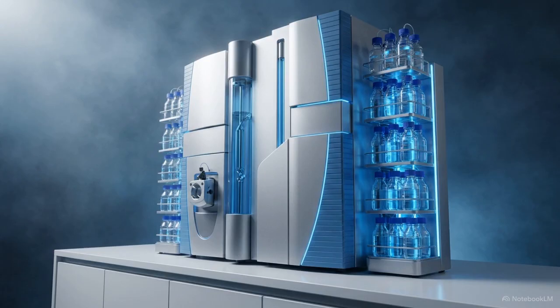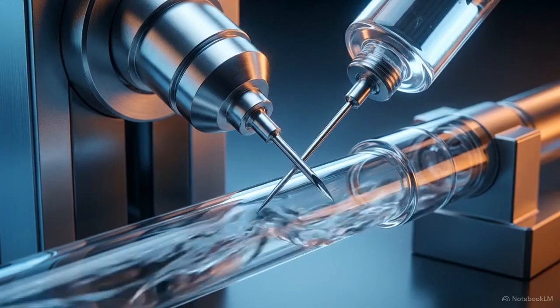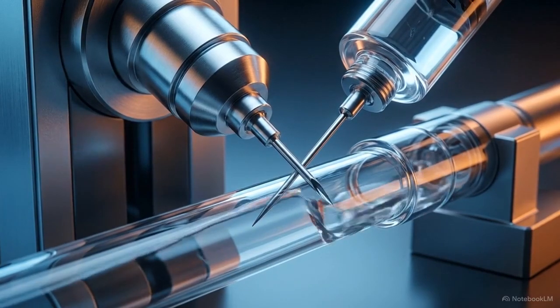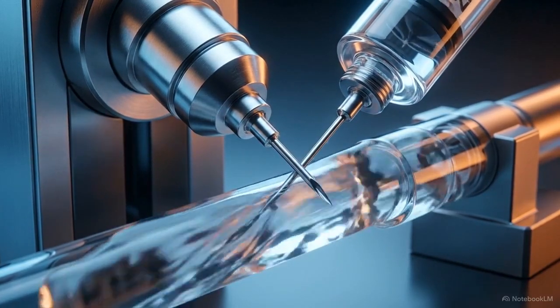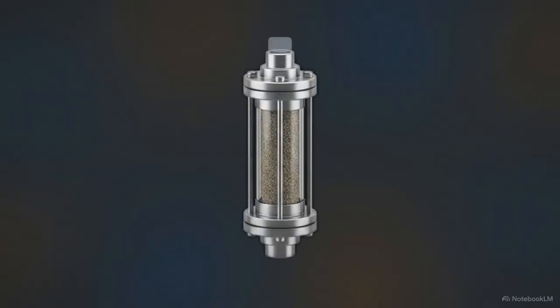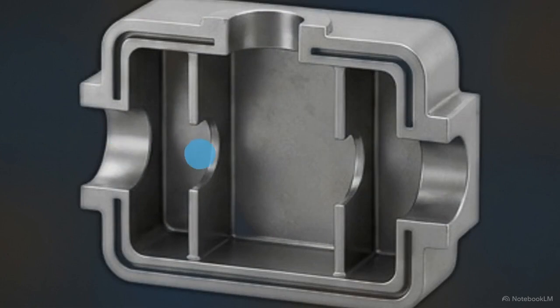Let's look at liquid chromatography mass spectrometry, or LC-MS. This is the required pathway if your compounds are non-volatile, highly polar, or thermally fragile. The process starts by injecting the sample into a liquid mobile phase. Because this happens at mild temperatures, heat-sensitive molecules remain completely safe. As the liquid pushes through the column, the compounds separate based purely on their polarity and how they interact with the column's stationary phase. This illustrates electrospray ionization.